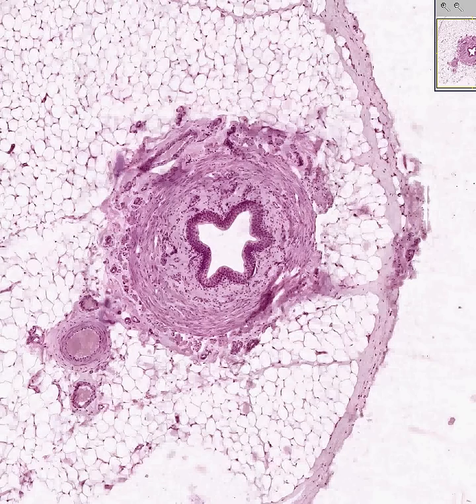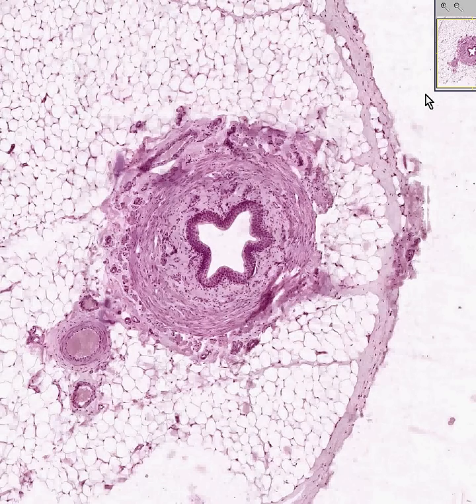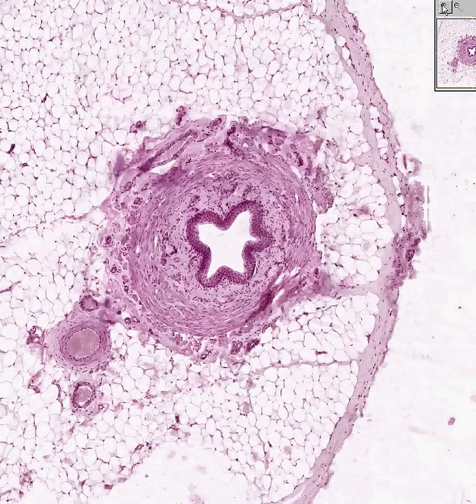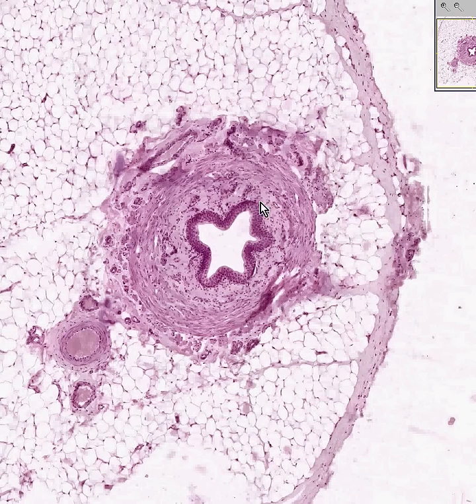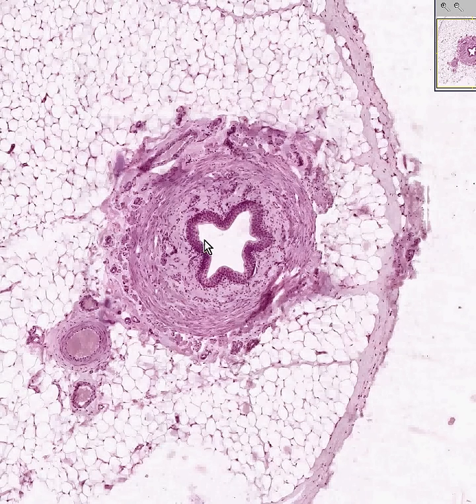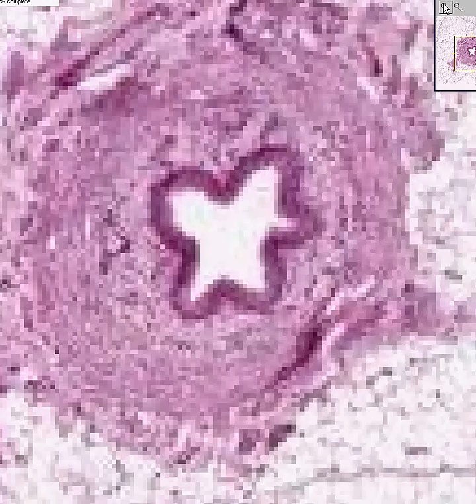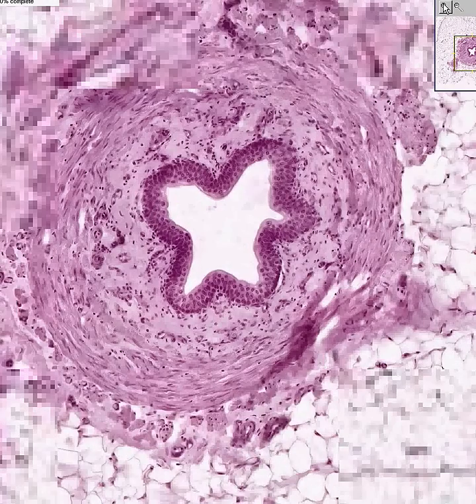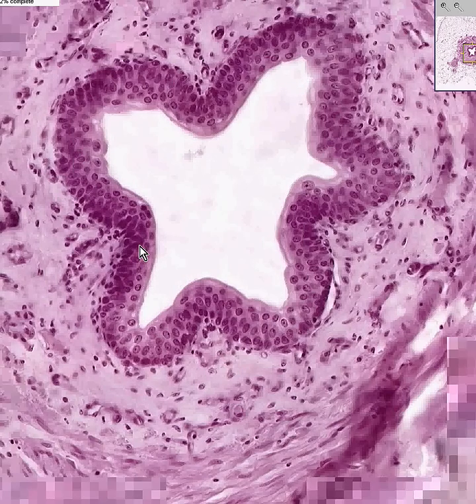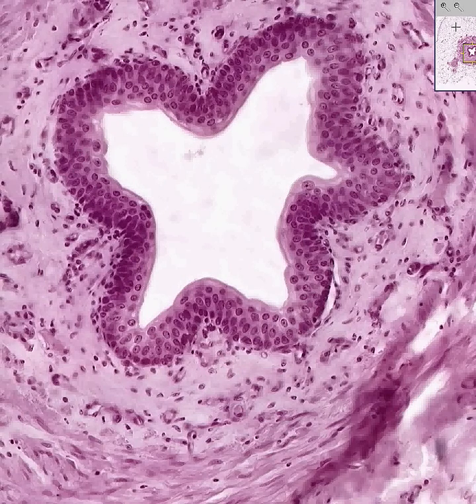This could never ever be anything else in the body except a ureter. Why? Because it's a relatively small structure. It has a little bit of a mucosal undulation or enfolding. And if you zoom in on it, you will soon see this is classical transitional epithelium. This is a ureter.